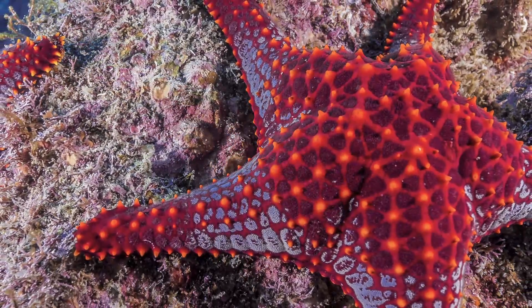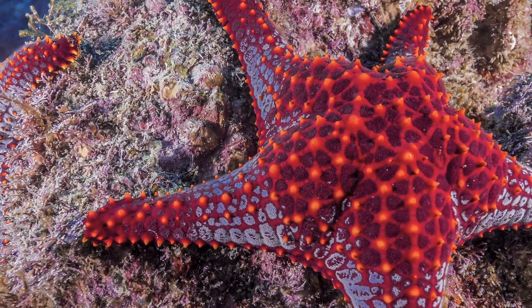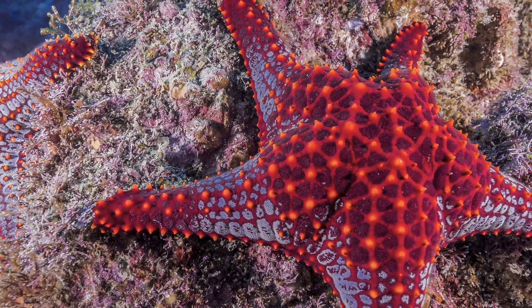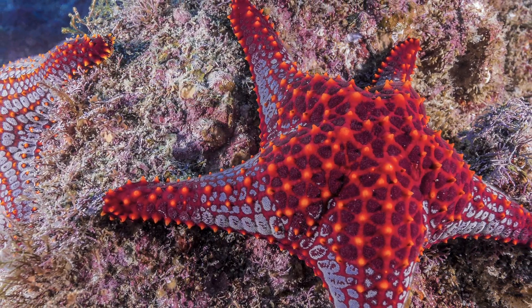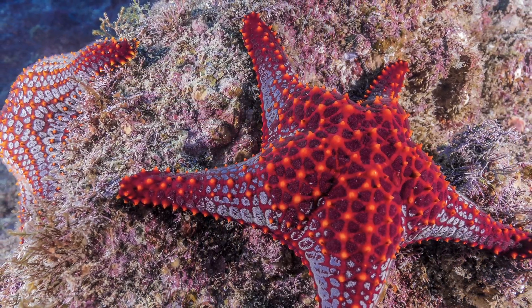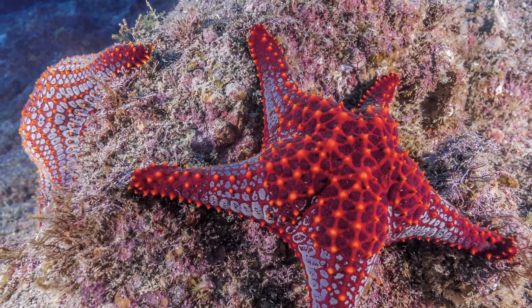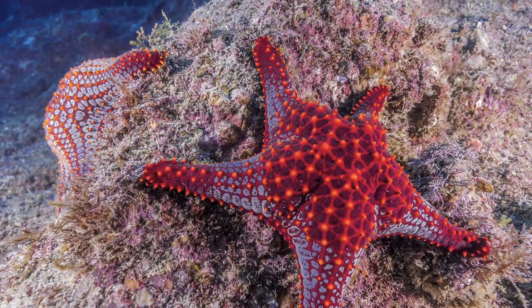Starfish are currently facing a number of natural and man-made threats that are decreasing their numbers. For this lab, instead of each student dissecting a starfish, you'll watch this video dissection. You'll then use this information to answer your lab questions.